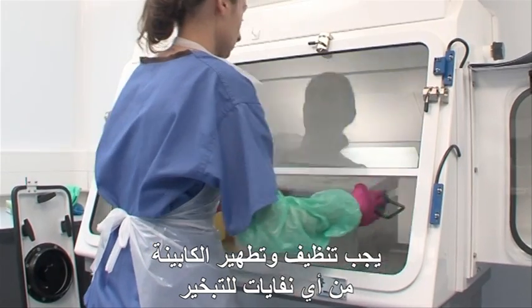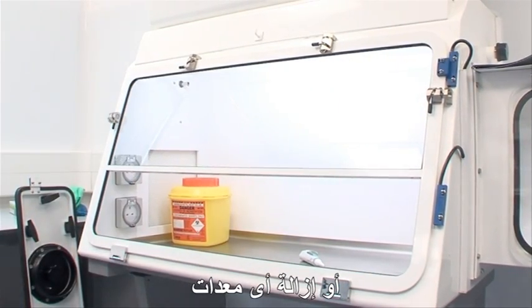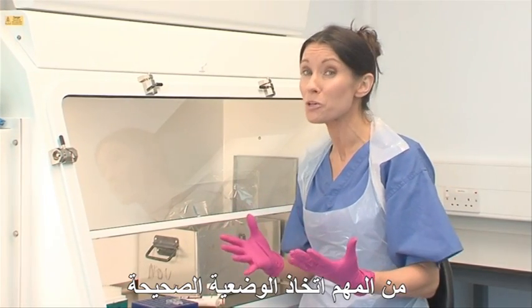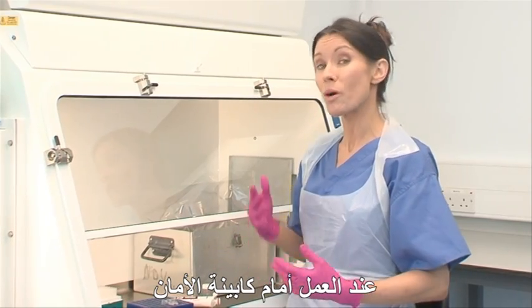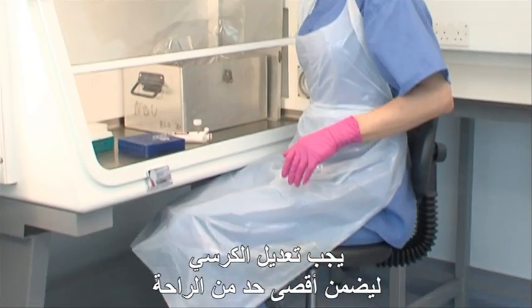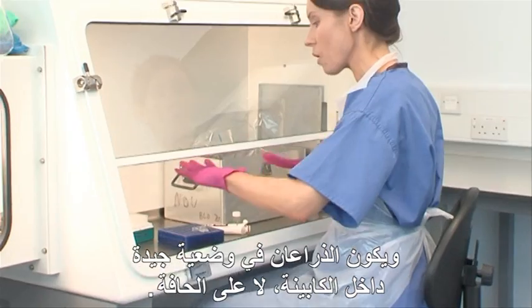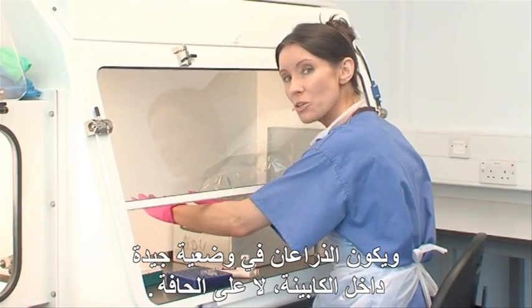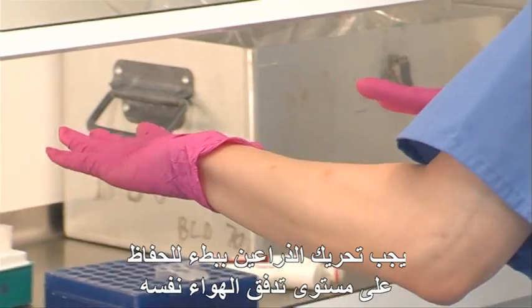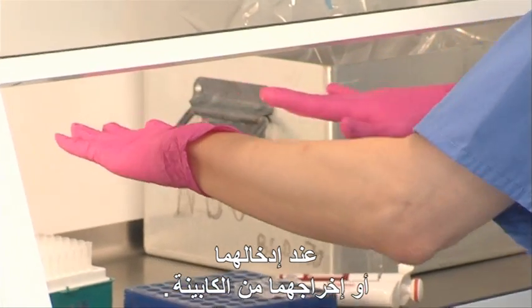The cabinet should be vented of fumigant and any fumigated waste or equipment must be removed. For both safety and comfort, it's important to adopt the correct posture when working at a safety cabinet. The chair should be adjusted to ensure maximum comfort with your arms placed well into the cabinet, not right on the edge. Your arms should be moved slowly to maintain the correct air inflow when moving them into and out of the cabinet.